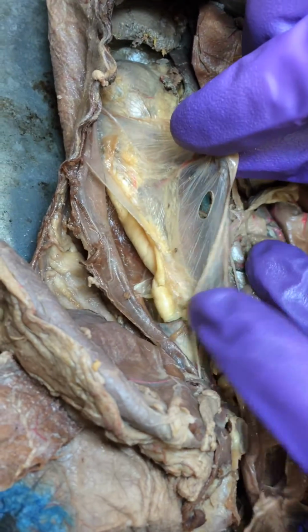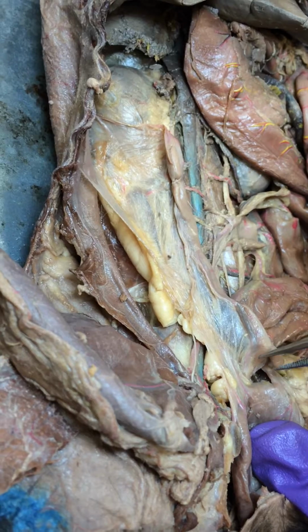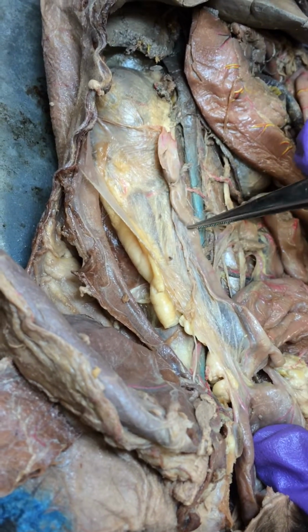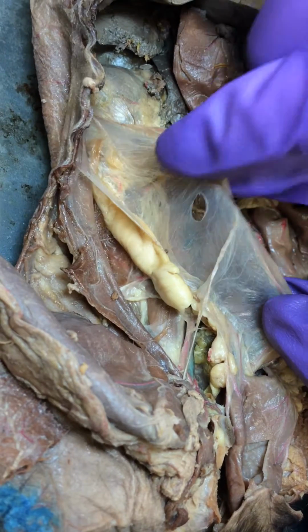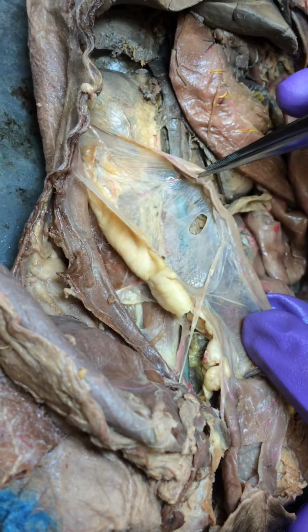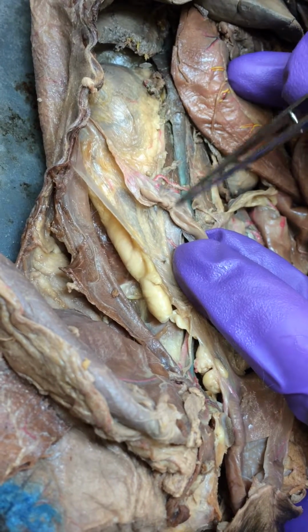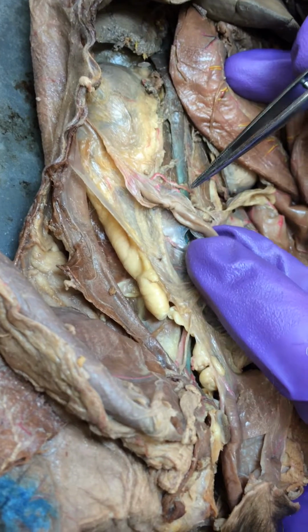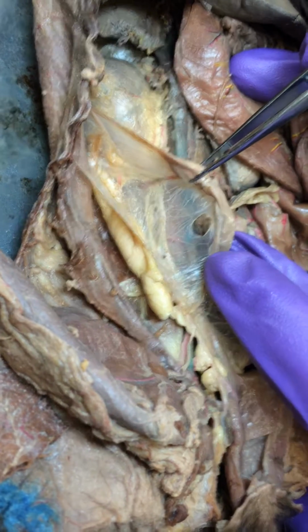And then the round ligaments of the uterus can either be from the cranial uterus or the cranial uterine horn. Ours comes off the uterine horn, and it's this piece right here, this fattening of the mesentery. And then there is a ligament that goes from the ovary to the uterine horn, and it's called the ovarian ligament. You can't really see that, or the mesosalpinx.